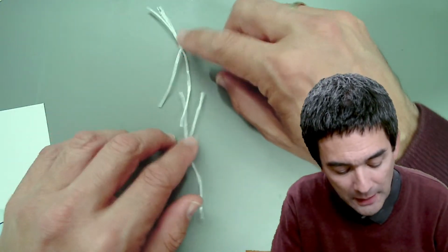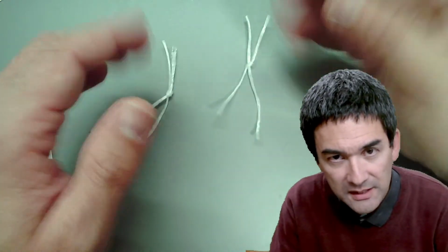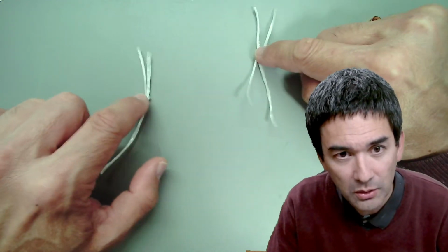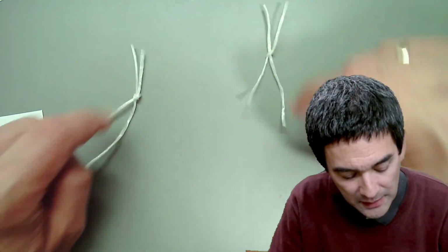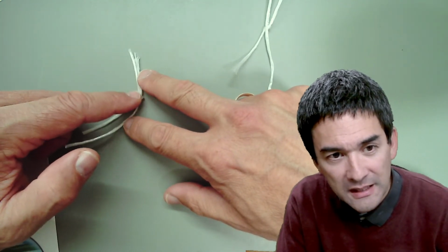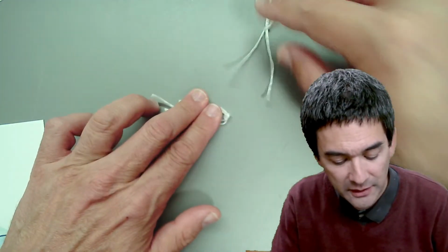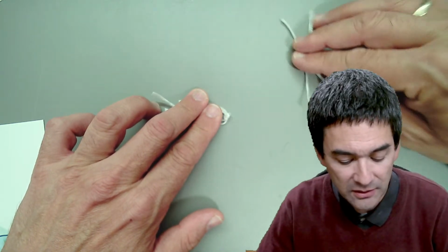But what happens now is the following. They were not yet in the center of the cell, so they're pulled to the center. They're so-called spindle fibers. These are protein fibers that pull them to the center. When they're pulled to the center, the arms of the chromosomes kind of fold backwards. So they're being pulled to the center, and this one over here on the side as well.